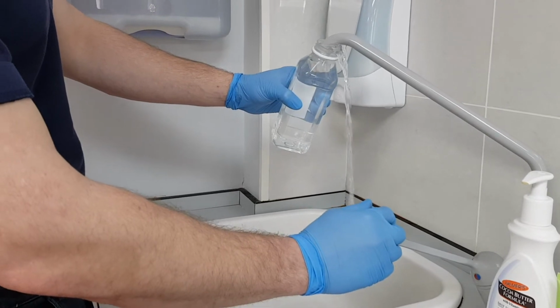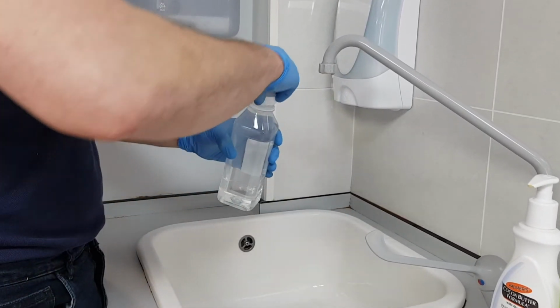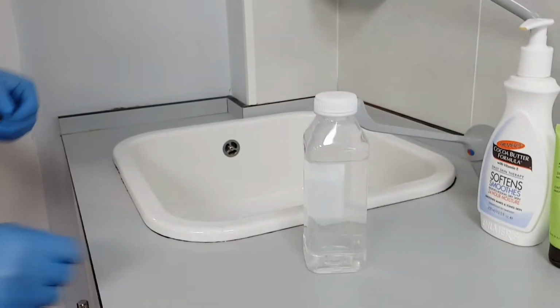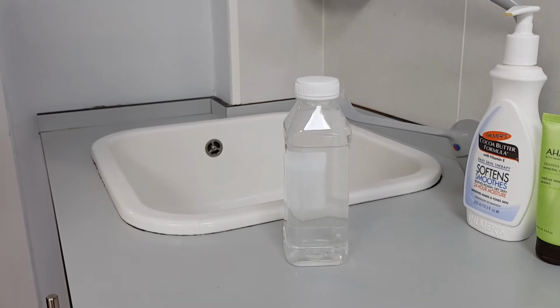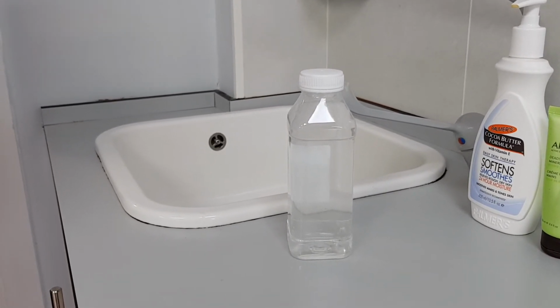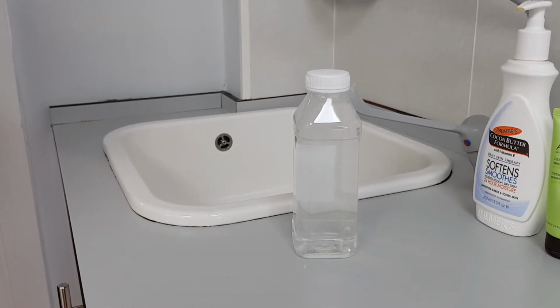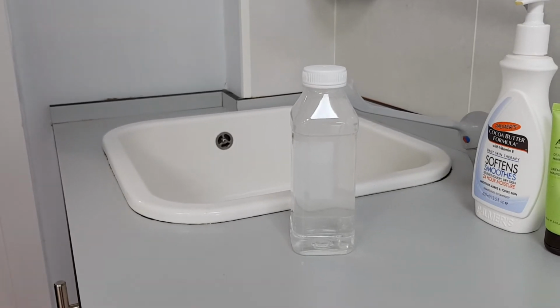You should also cool if necessary, as high temperatures interfere with the test. To cool, fill a clean sample bottle to the brim, cap it securely, and then run cold water over the outer surface for a minute or two. Filling to the brim and capping the sample will prevent the loss of chlorine dioxide to atmosphere before testing. Sample bottles used for this test should not be treated with thiosulfate, as this will neutralise any oxidants present.